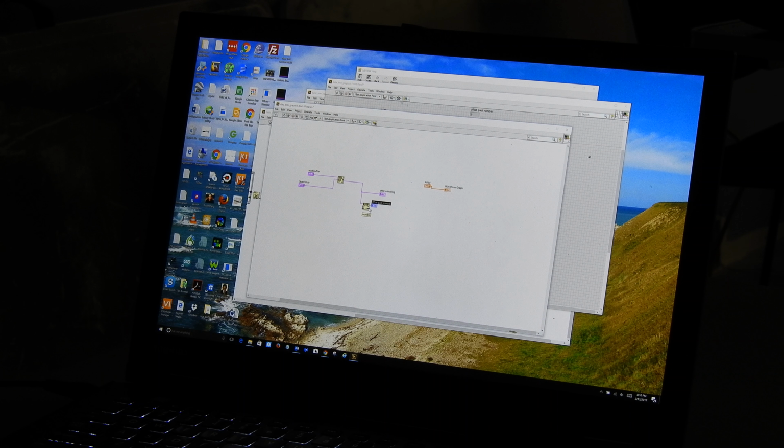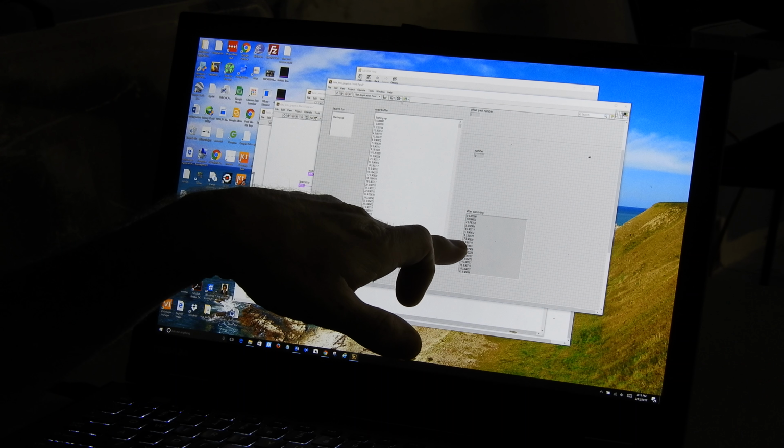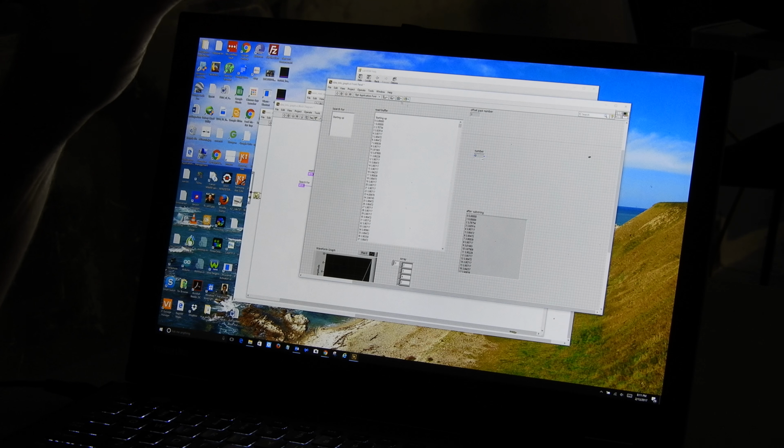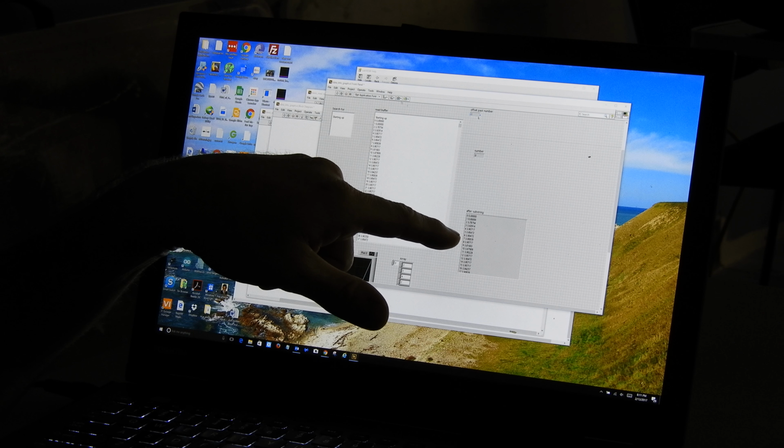What this VI does, I'll just tell you, it looks for a decimal number starting at the beginning of the string, and it will give us this number in the number output, and the offset past number will tell us how many characters in it took to get to that number. All right, so let's just run that real quick and see. We're operating on this one. It found the number 0, 1 character past the beginning. So here's the offset of 1.